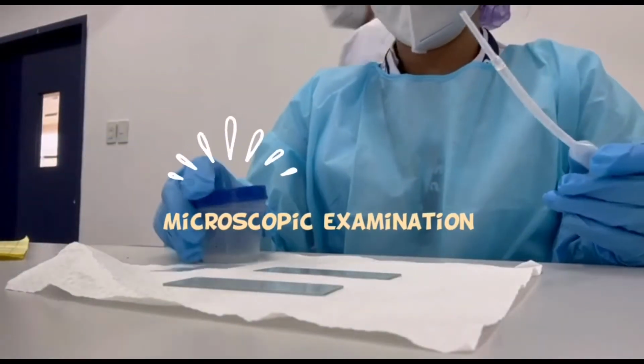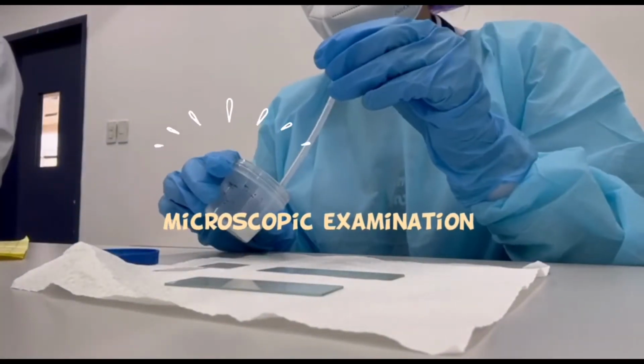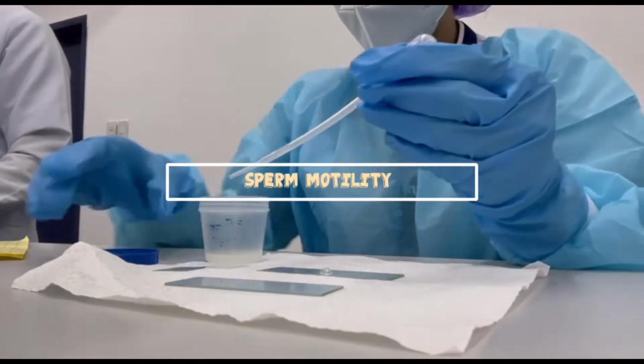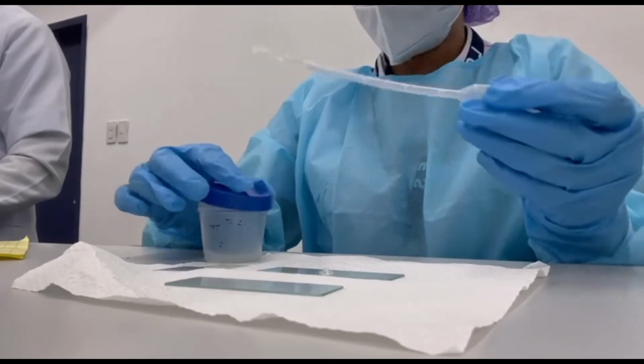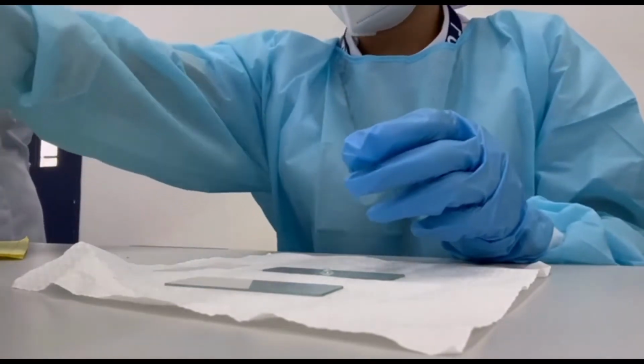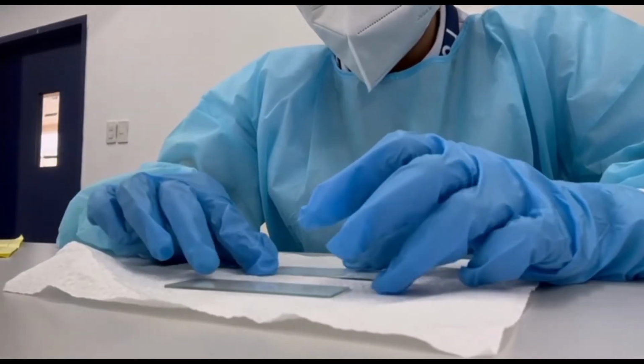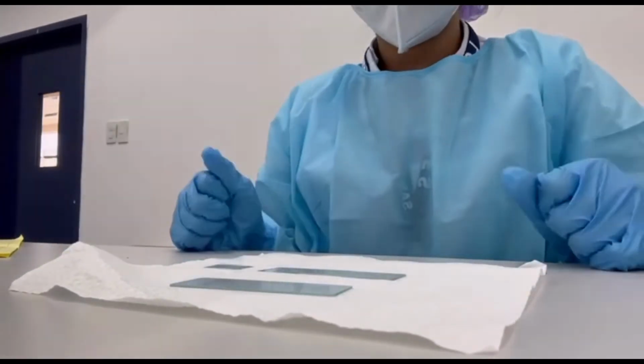Up next is the microscopic examination of the semen. First is the sperm motility. For sperm motility, add 1 drop of semen into a clean glass slide, cover it with a clean cover slip, and view under microscope using high-power objective.